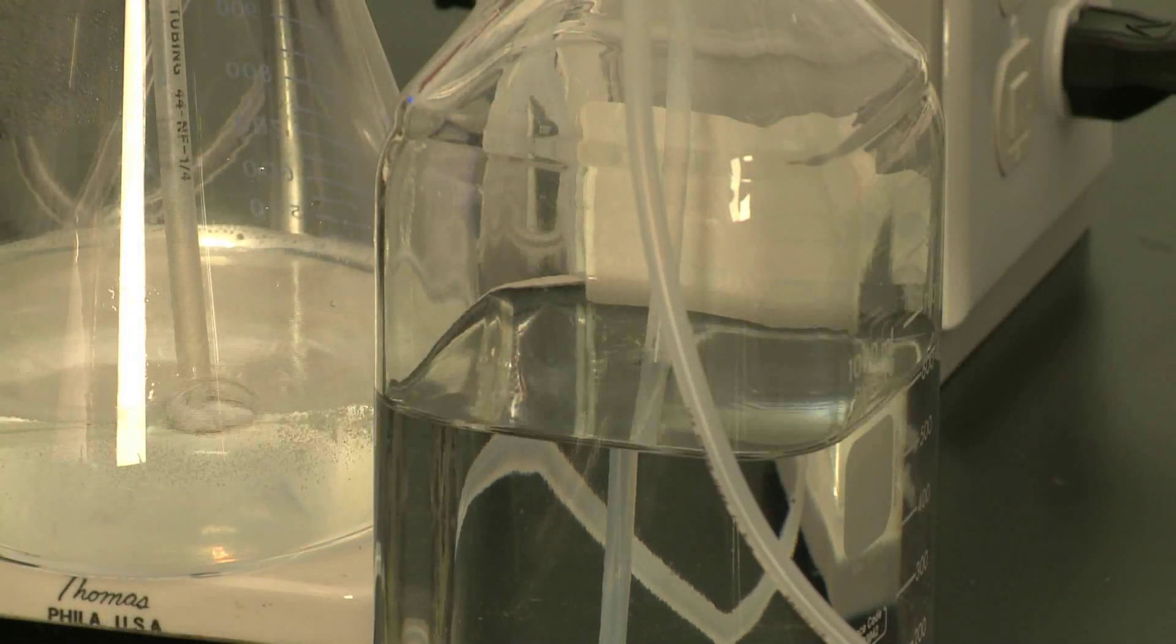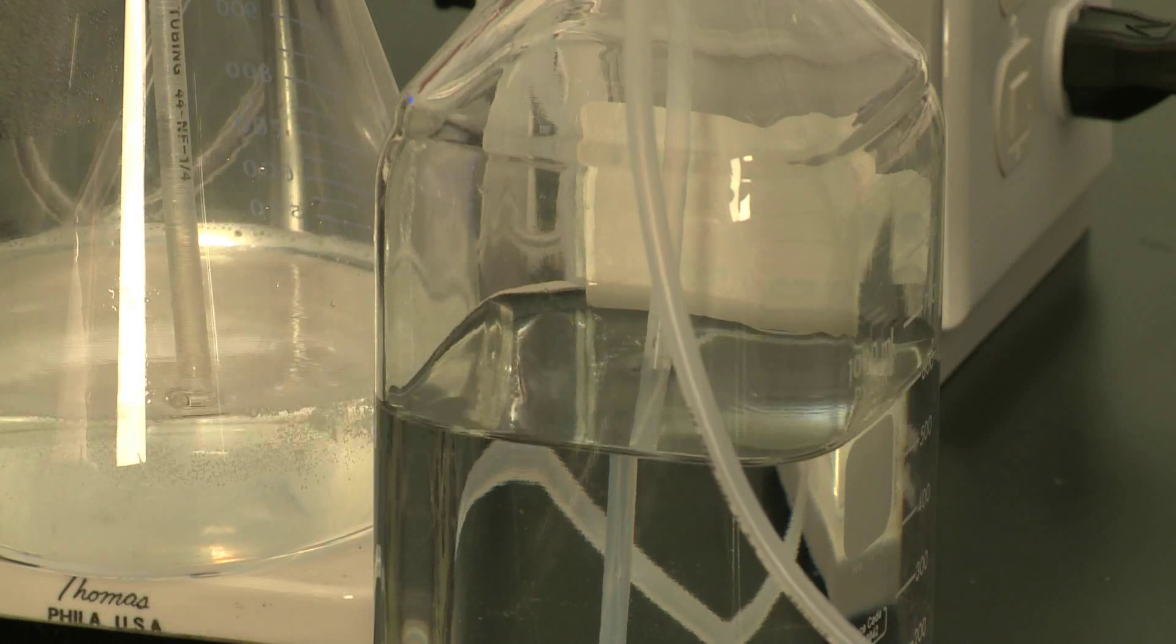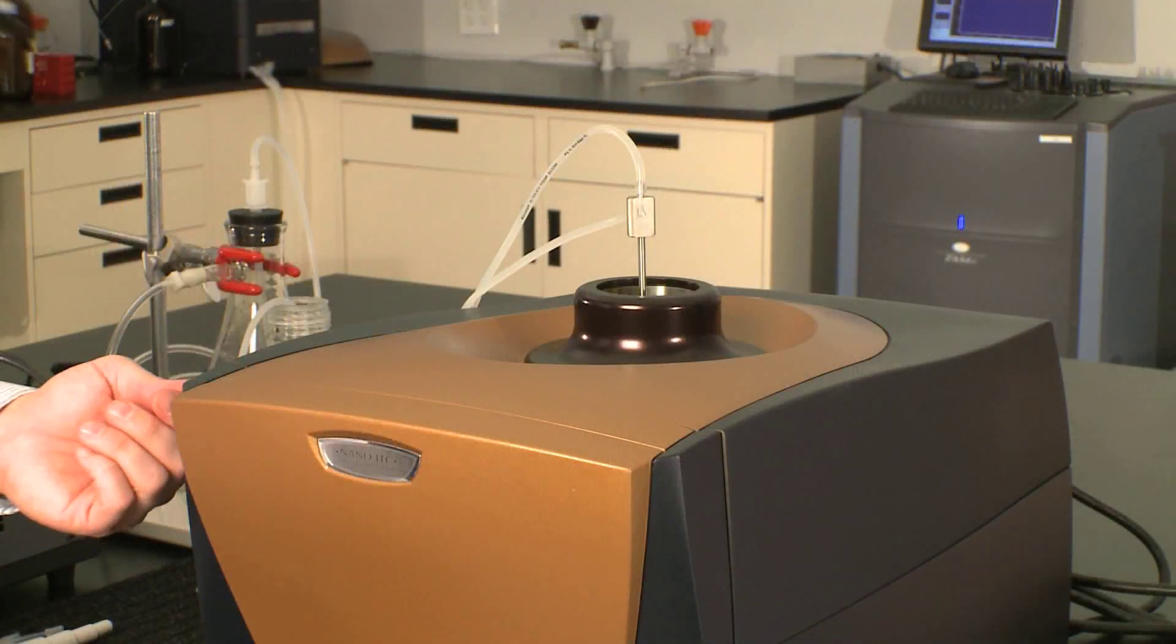And then you could even follow up with a little bit of ethanol or methanol to make sure that the ITC cell is dry before you load the next sample.